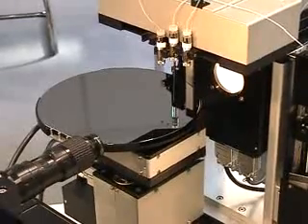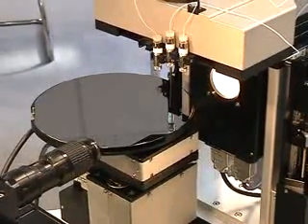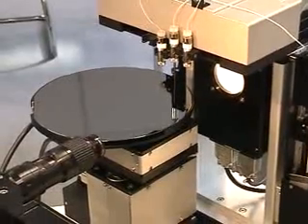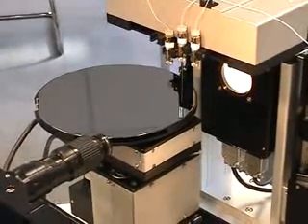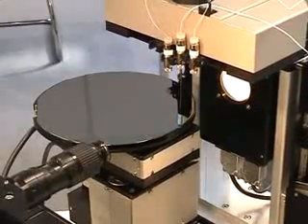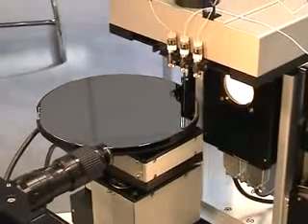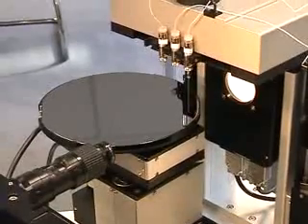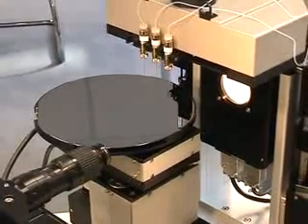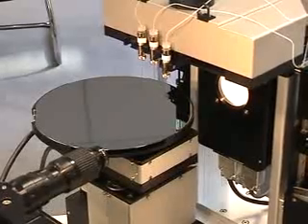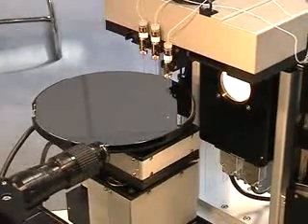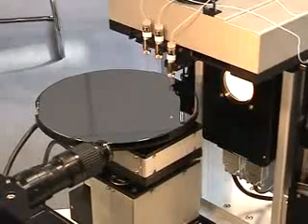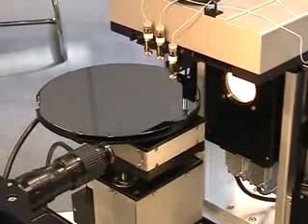It is possible to position all the droplets in a complete random manner. What we also see at the moment is that we can work with different liquids on a certain range on the wafer. This will yield us some values later for the surface energy determination.